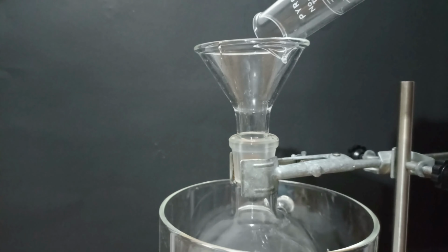I decided to use aluminum foil in order to get a large area, but please don't do this, it was a mistake. The sample still contains hydrochloric acid, which reacts with aluminum. The good thing is that I know this early, but this definitely hurt my yield. I dried it for 2 hours at 90 degrees Celsius, and I got a very dry product at the end. I was able to collect 22.14 grams of p-aminophenol hydrochloride.